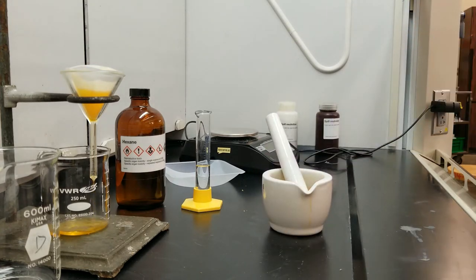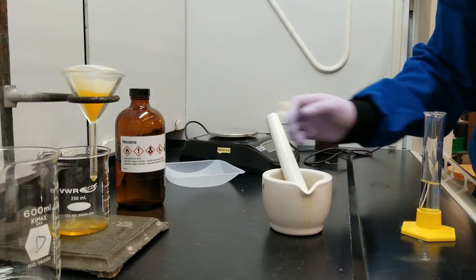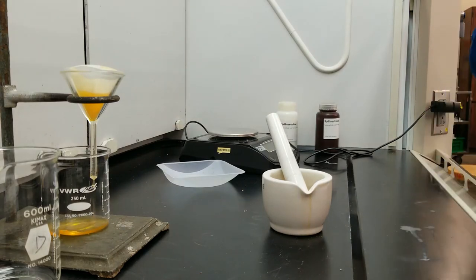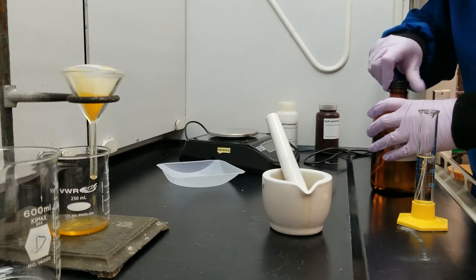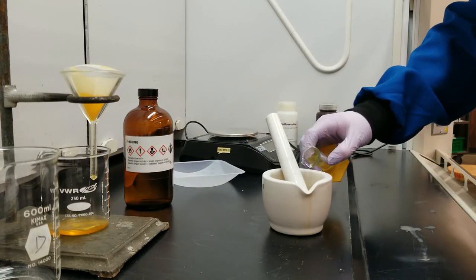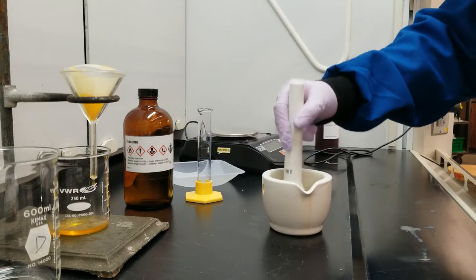I want it to be about 20 milliliters. We're doing a second addition because we want to really make sure we're dissolving all of those fats from the potato chips. This way, we've rinsed off some of them and are giving an additional portion of hexane to really dissolve any leftover fats left on those potato chips.